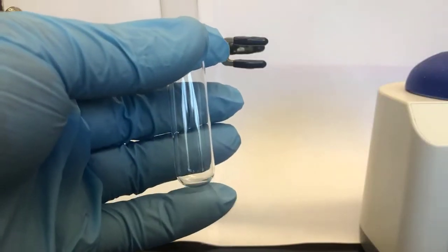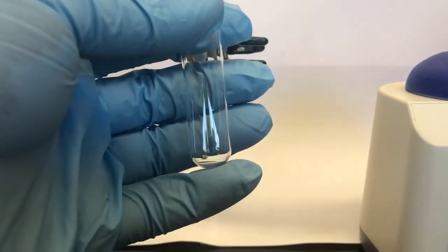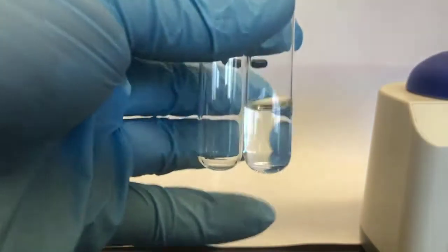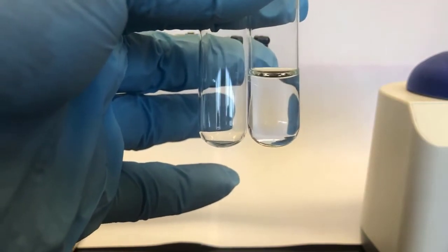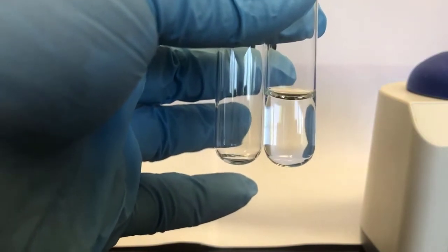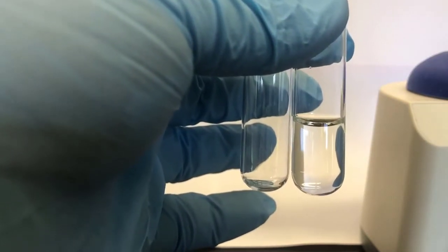Before we get started, this is one of those things I'll say in class, but it's not the way the lab is actually recorded. Oftentimes you're asked to get a certain volume, and this is a test tube with 3 mL of volume in it. For these qualitative experiments, like Le Chatelier's principle, where you're not trying to make quantitative measurements, you're making observations, this serves as a pretty good reference for the volume. The counting of the drops very much depends on the size of the pipette tip and what you're dispensing out of. So having said that, I'll add the potassium dichromate to match the volume.